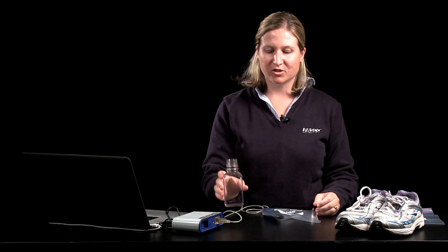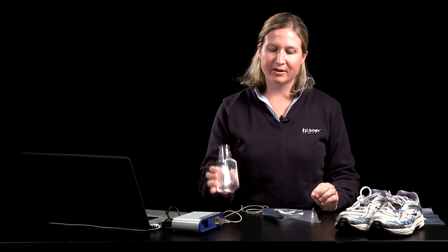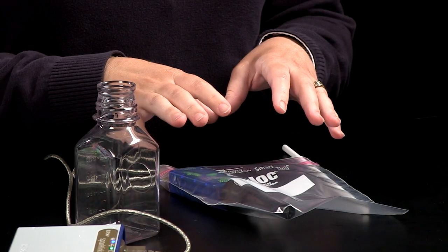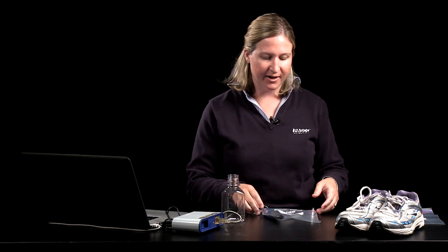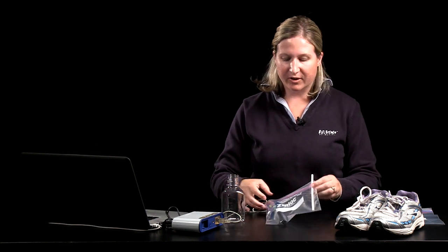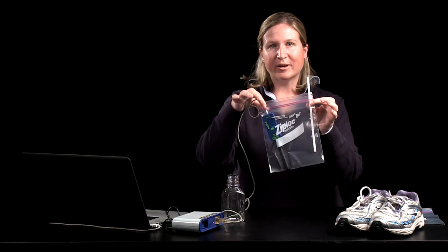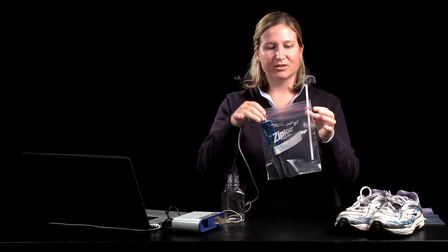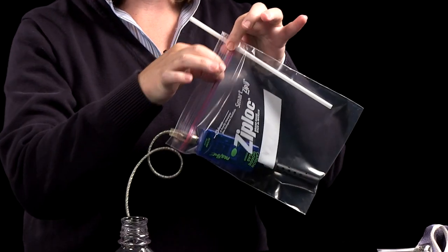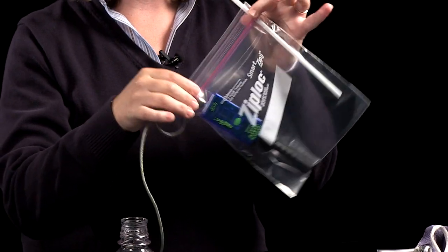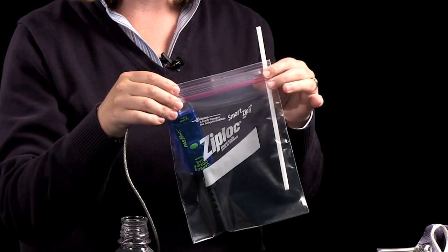For this activity we're going to use just the carbon dioxide gas sensor by itself, and instead of using a sampling bottle or metabolism chamber, we're just going to use some plastic bags that zip close. And this is convenient because with the sample bottle you have to be sure to refresh the air in the bottle between trials. With the plastic bags you can just use a new plastic bag for each trial, and you don't have to worry about refreshing the air. So I have my carbon dioxide gas sensor and a straw, and the rest of the bag is sealed up around those items. And on the screen I've set up a bar graph to collect the amount of carbon dioxide.